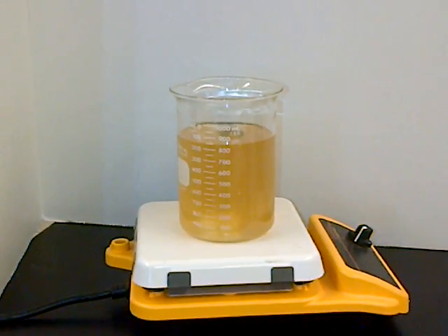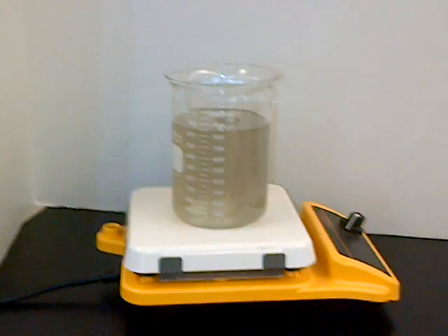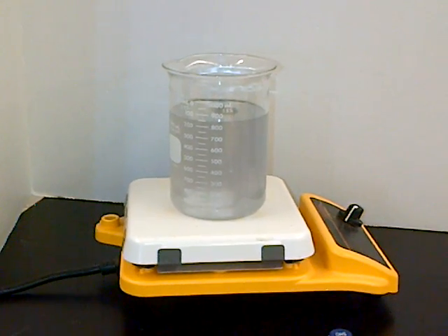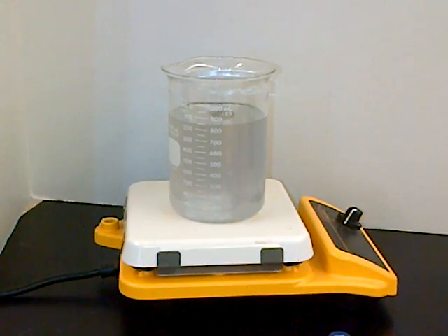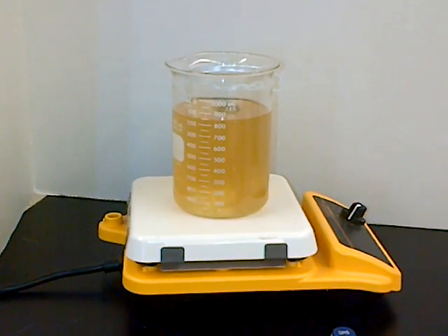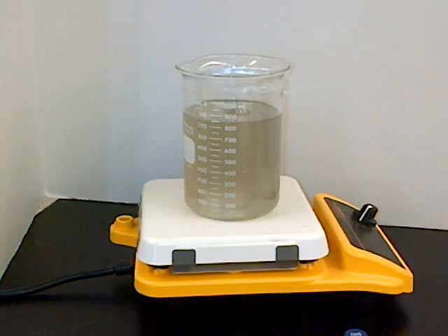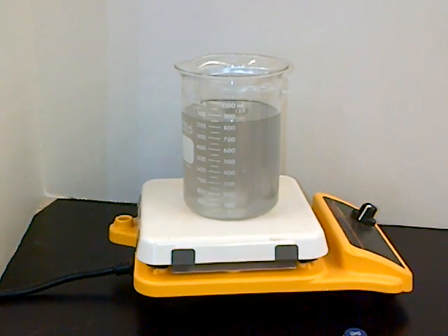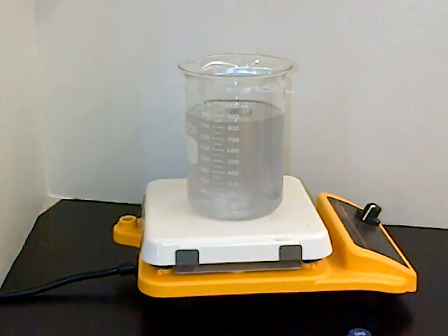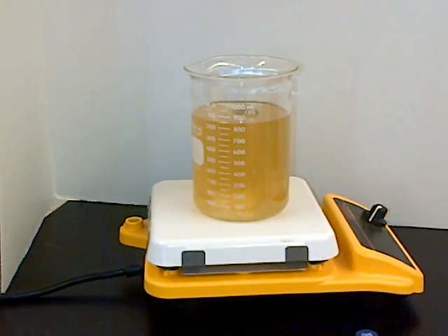Is this the oxygen coming in? And carbon dioxide. And probably the occasional water molecule as well, but for all seven reactions, there's nothing that's being released that's dangerous, or else I would have done it under the fume hood. Those are the only gases that are coming off. If it smells, it's not too bad.